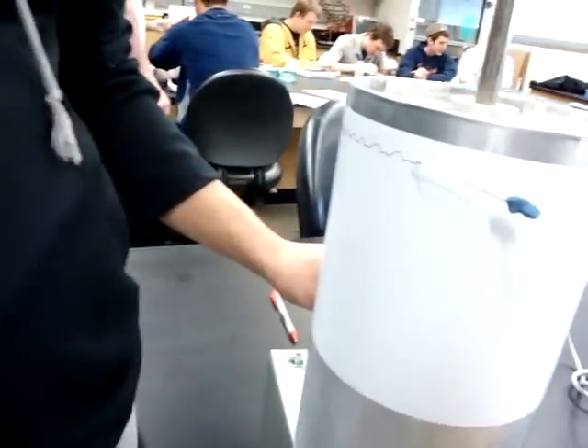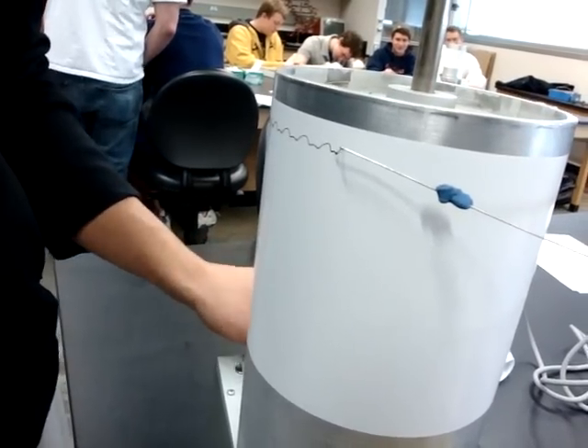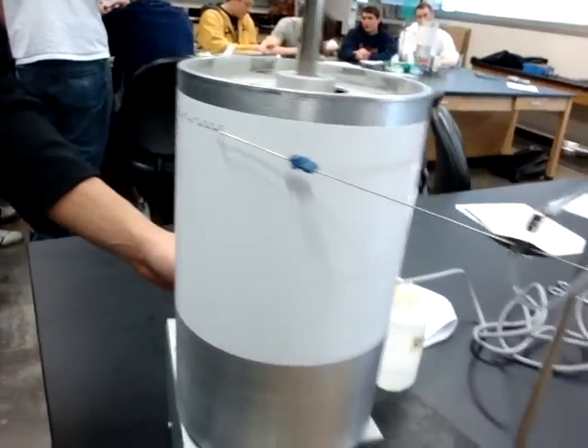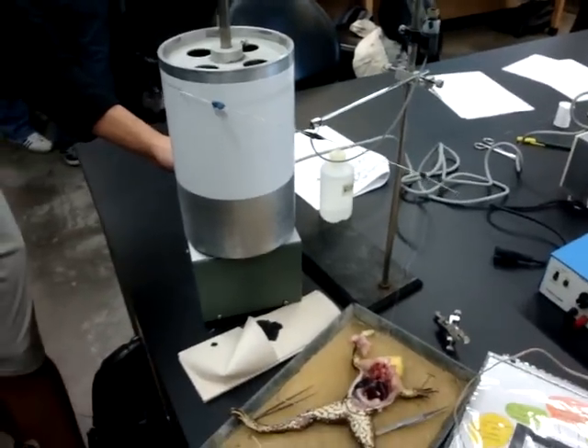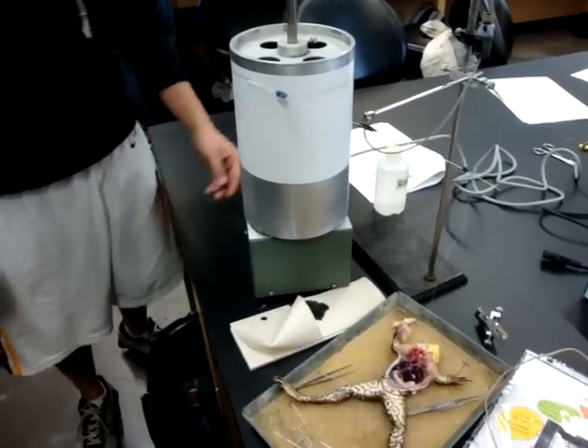What the heck is going on? I'm just putting it up to see what it looks like. Very nice. Because you got both bumps. It's very difficult to get both bumps, but you have both bumps. You're very nicely recording on there. How do you move the drum up and down?